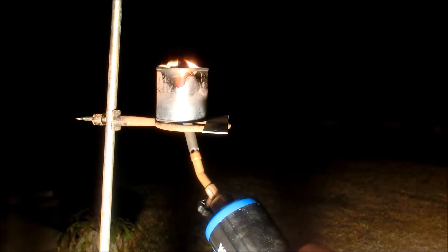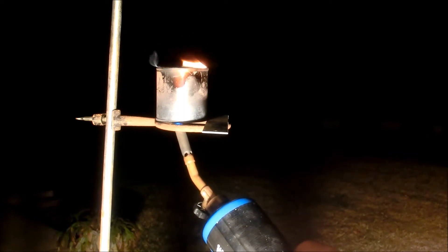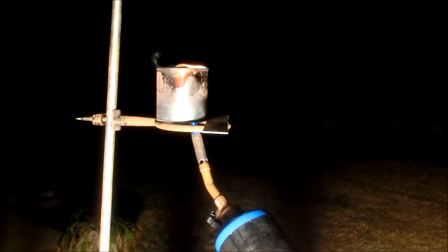Once the flame goes out and things barely smoking, you can stop heating and let the can cool down.